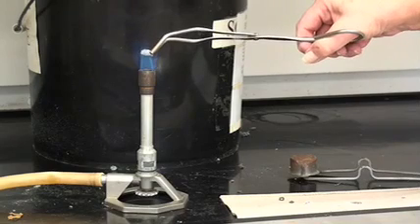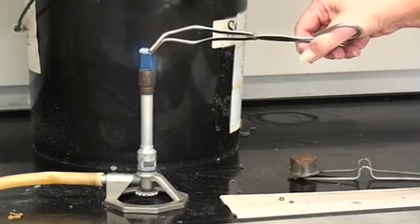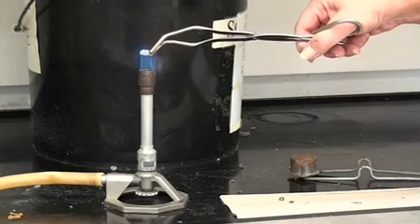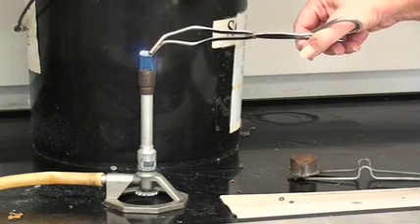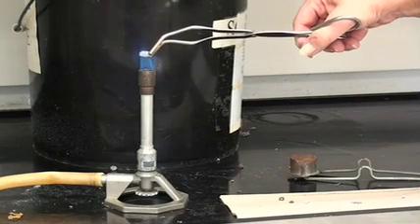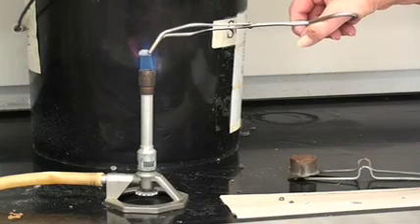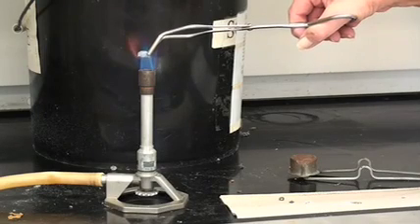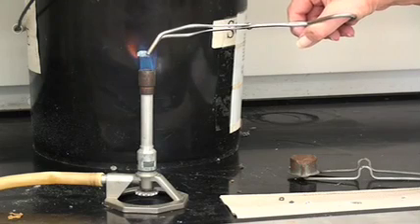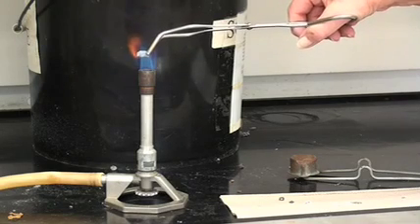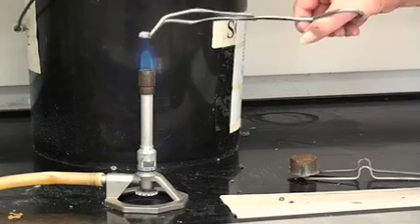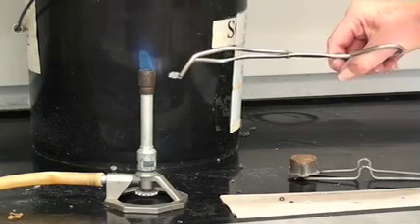And the point is that almost immediately it's turning white even before it was turning white for the magnesium. You'll also notice how we're getting to see how it's burning, see the bright red color on the surface, and now we're seeing the same white coating on the piece of metal.